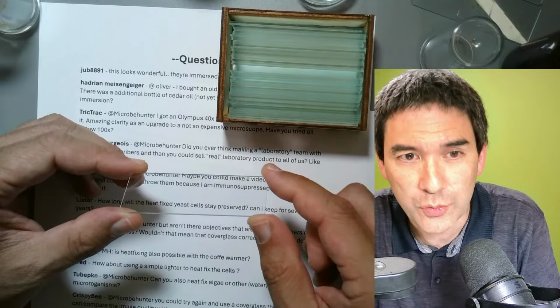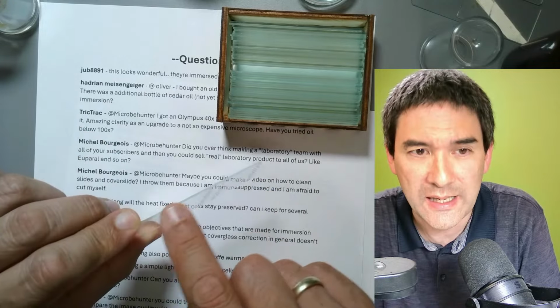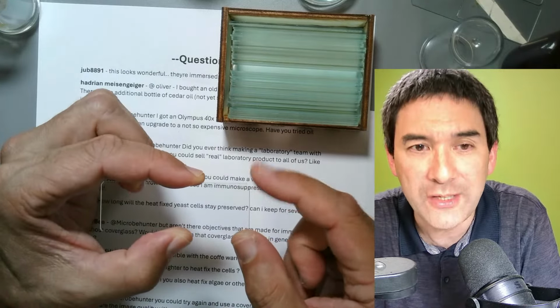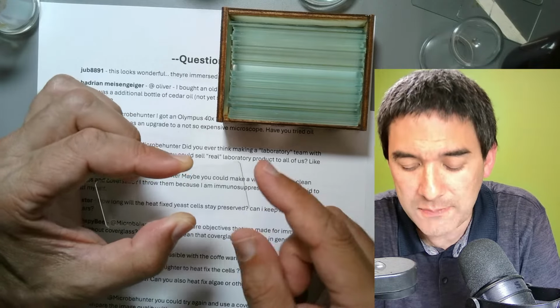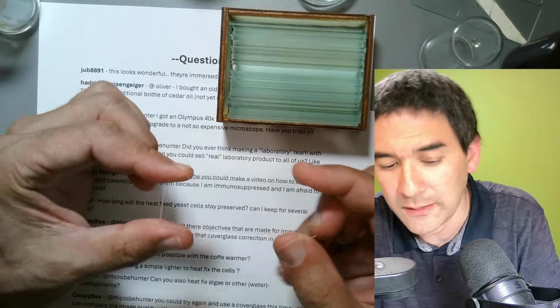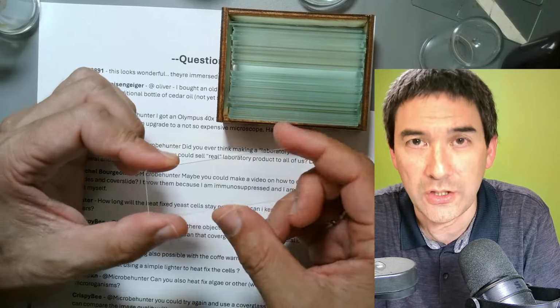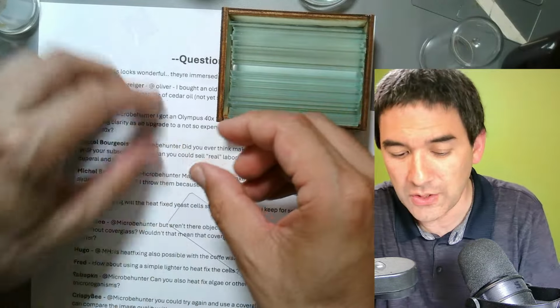So for this reason, I bought slightly better slides, and those slides have polished corners, and maybe you're able to see this over here, that the edges are also cut at 45 degrees. Okay, so this basically means that they are much better to handle. And if I clean them, then there is with those not so much of a danger of cutting yourself. The issue is, of course, always different with the cover glasses because they can break.